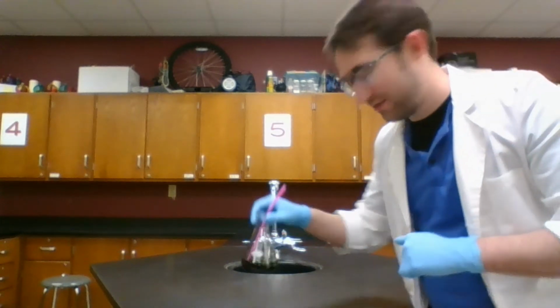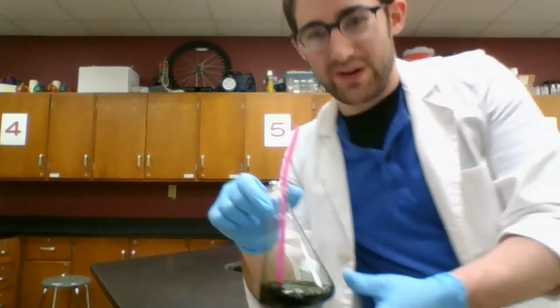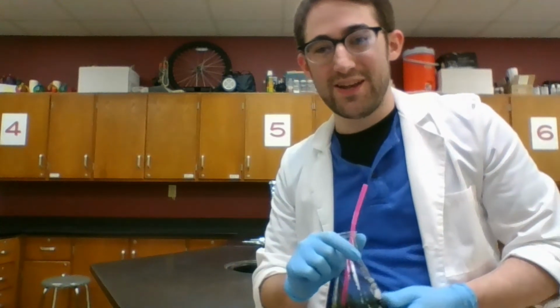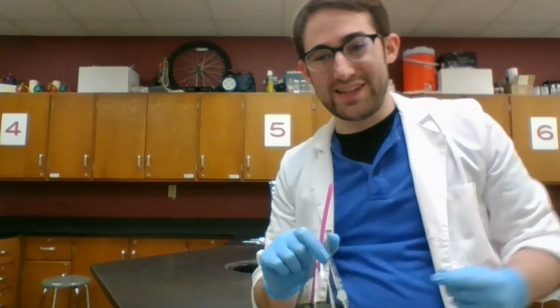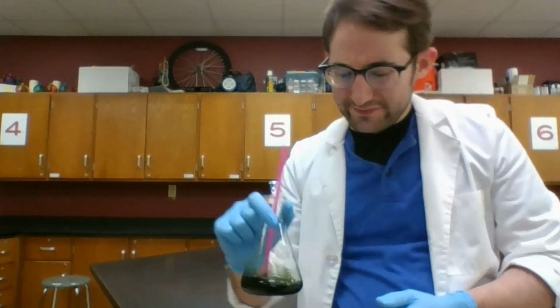I've got a straw here. I've got a flask of a liquid we call universal indicator, and like the name suggests, it indicates. Typically in chemistry, indicators are meant to show how acidic or basic something is. You're probably familiar with some common acids, the things in your food and drink that taste kind of tangy or sour. You've got hydrochloric acid in your gut. That's your stomach acid, and it's what I used to react with that aluminum back there.